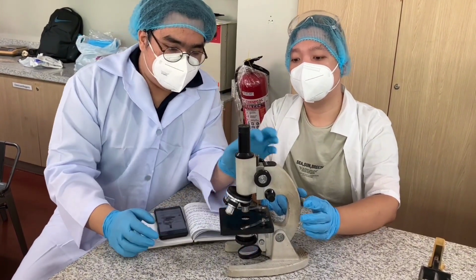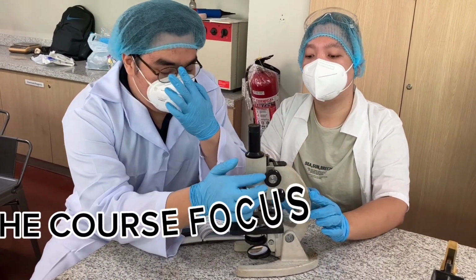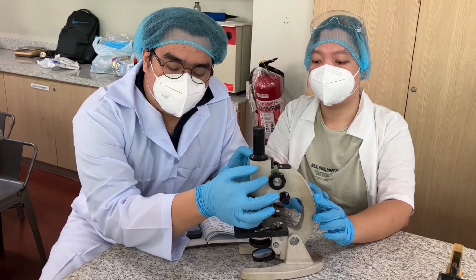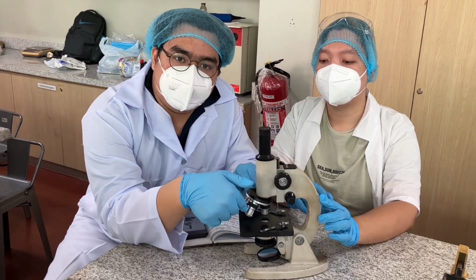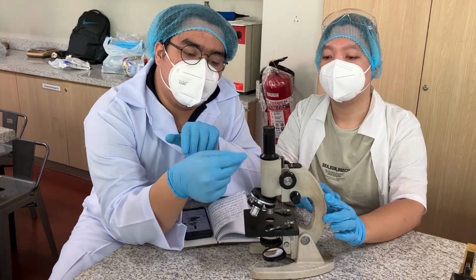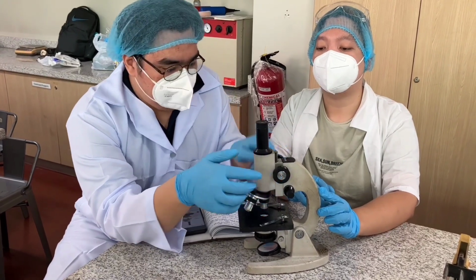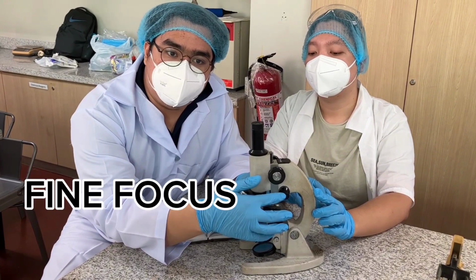Mainly, this thing. This is the coarse focus. The main function of this knob when you turn it is to adjust the distance between the lens and your specimen. So when you're looking for specific magnification of your specimen, this is one tool that you can use. Now, right here, this is the fine focus knob.